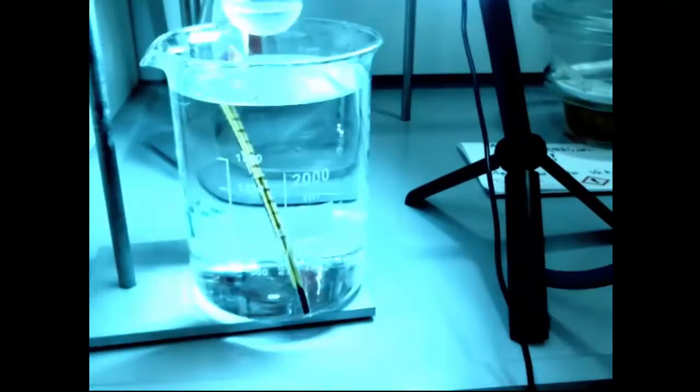So that was fast forwarding through some setup there. Now I'm pumping a vacuum into my container at 20 degrees and we can see that very little is happening. There's nothing in there apart from methanol and I get the pressure down quite low. We're going to go a bit faster over this as well because there's a lot of this and nothing happens at all. I was hoping that it would boil at this point, but it didn't. So nothing happened at 20 degrees.